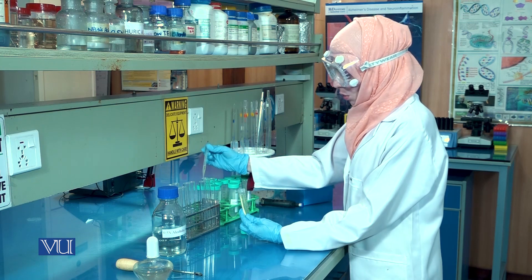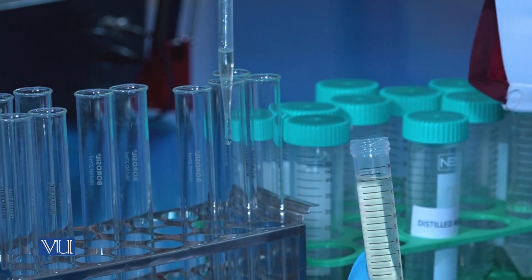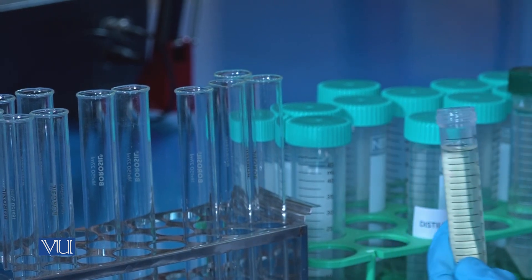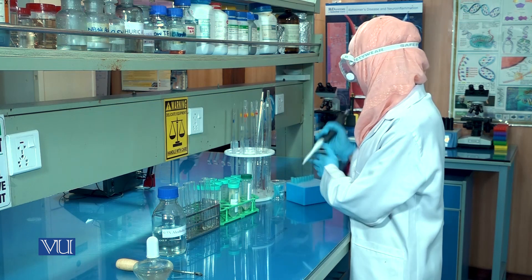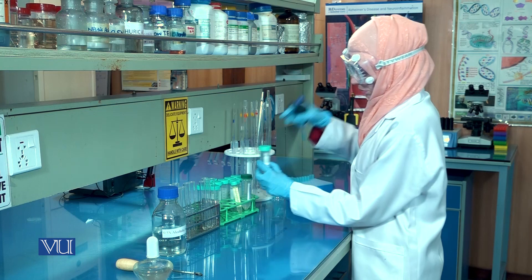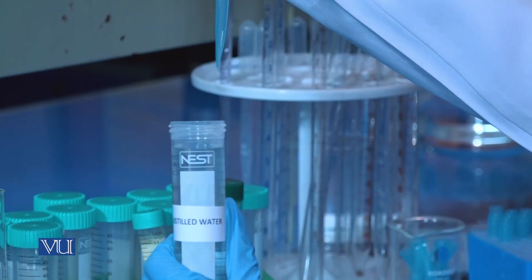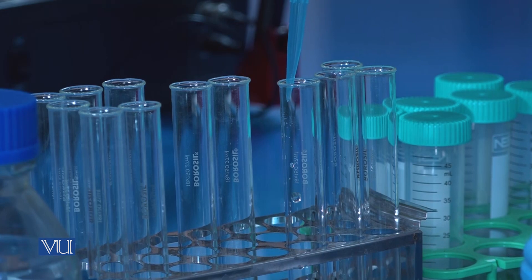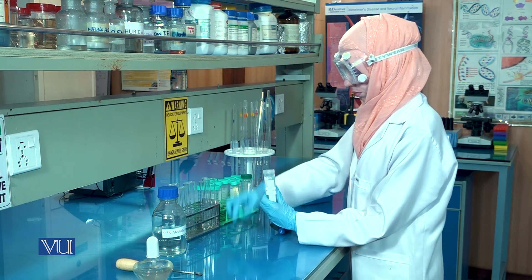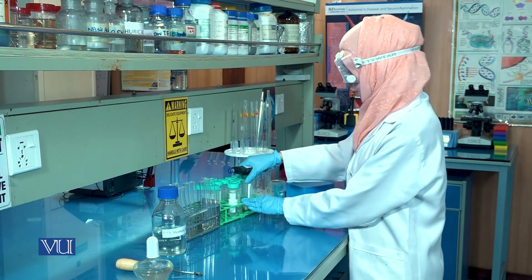To proceed with the solubility test, we will take a small volume of the sample in a test tube. To one test tube, we will add 2 ml of distilled water. To the other test tube, we will add 2 ml of chloroform.